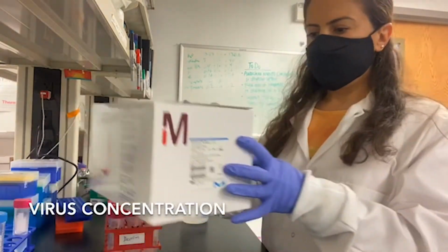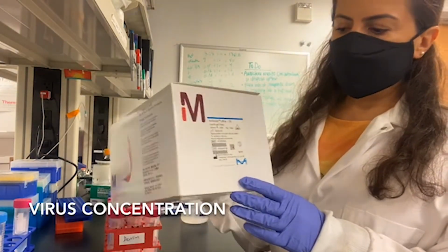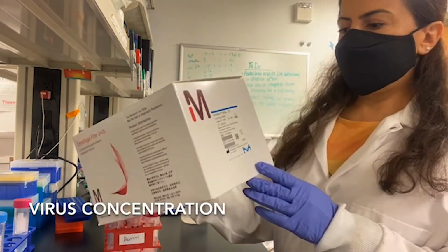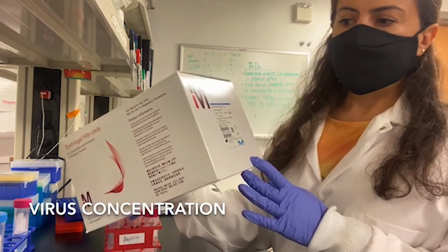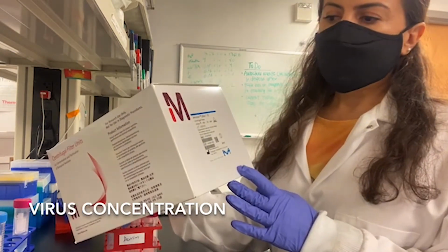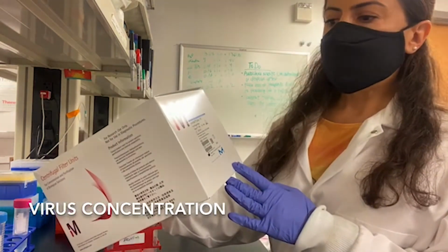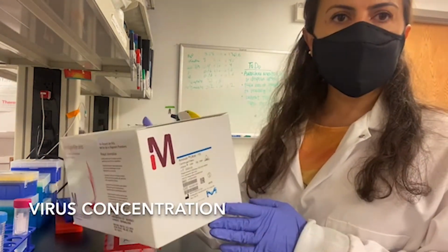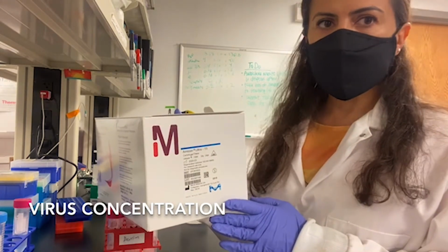Hello everyone. So to concentrate wastewater samples, I'm going to use Millipore centrifugal filter units. The ultrafiltration filter unit can filter up to 15 milliliters of the wastewater. It has a 100 kilodalton molecular weight cutoff for the membrane in it.